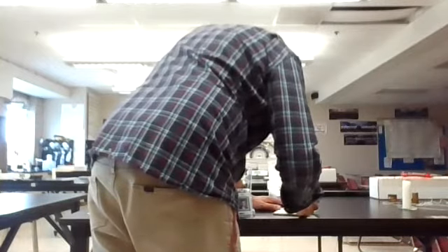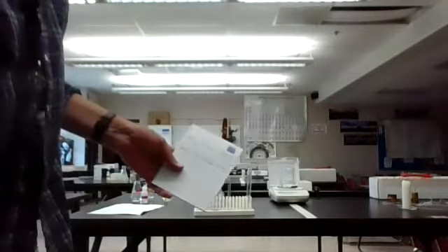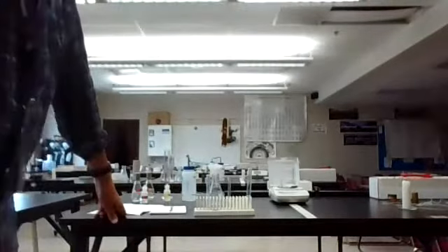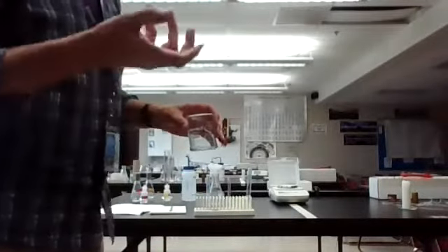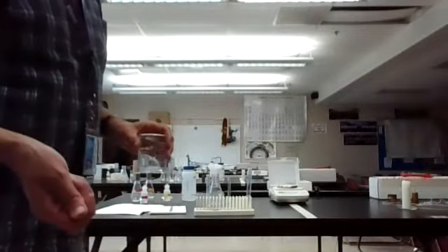If I'll recall for you, the mass of the ice in the beaker was 115.63 grams. We lost a tiny 0.04 grams, probably due to evaporation or maybe a little spill or something like that. Okay, this is more considered a physical change, and here's the easiest way to tell the difference. A physical change can be easily reversible. In other words, I could take this, if I put it into the ice cube maker, it would freeze and make ice. I can change this and put it back to what it was pretty easily without using up a whole bunch of energy.